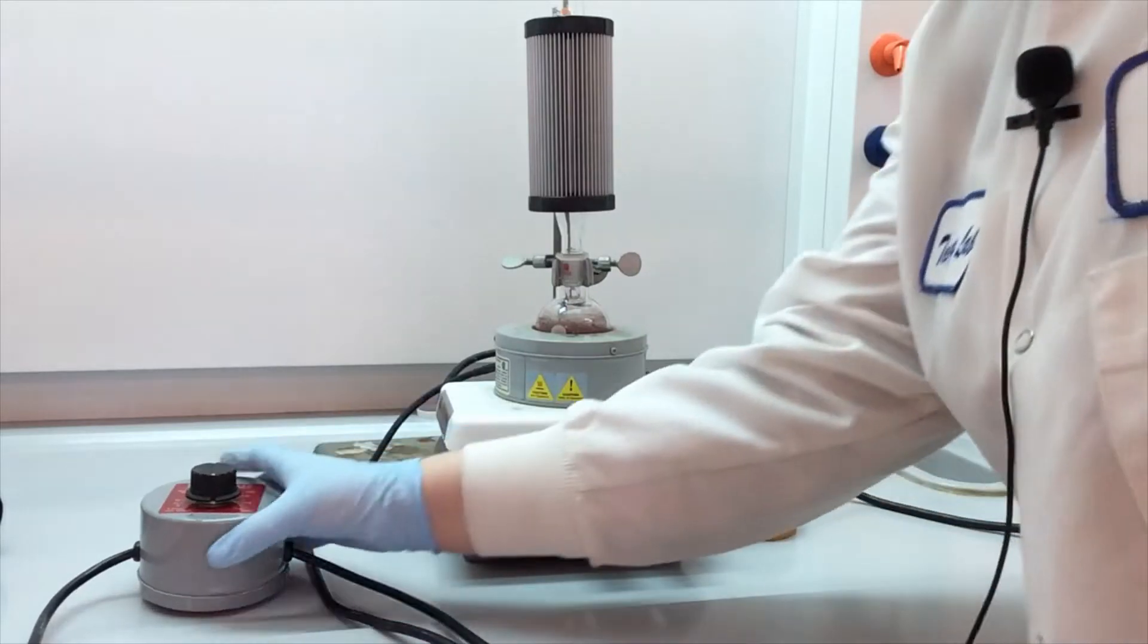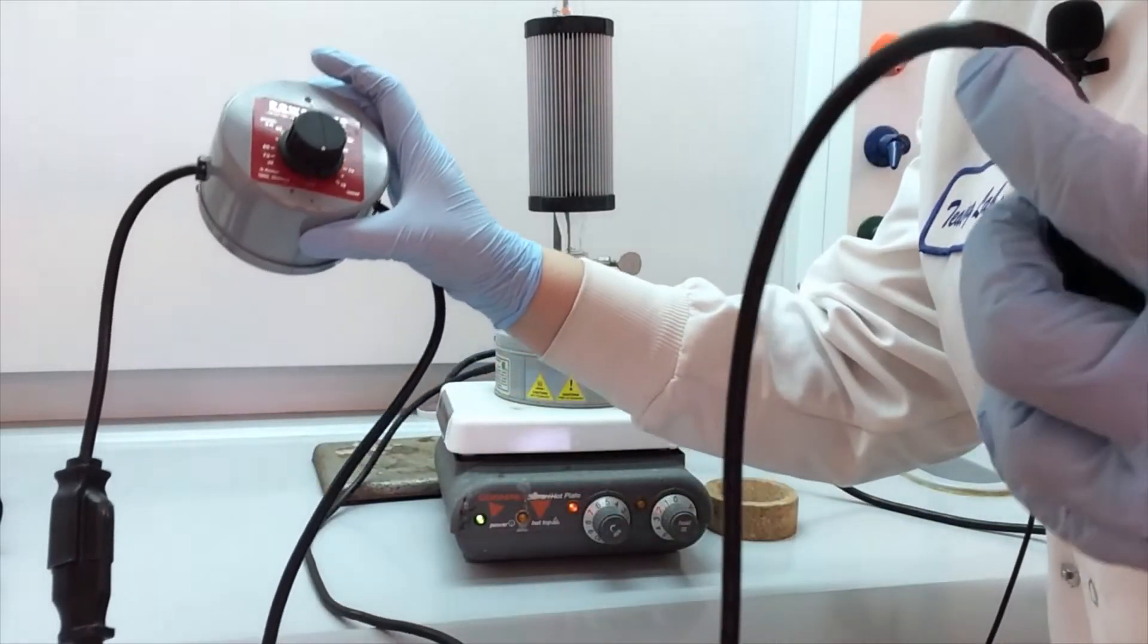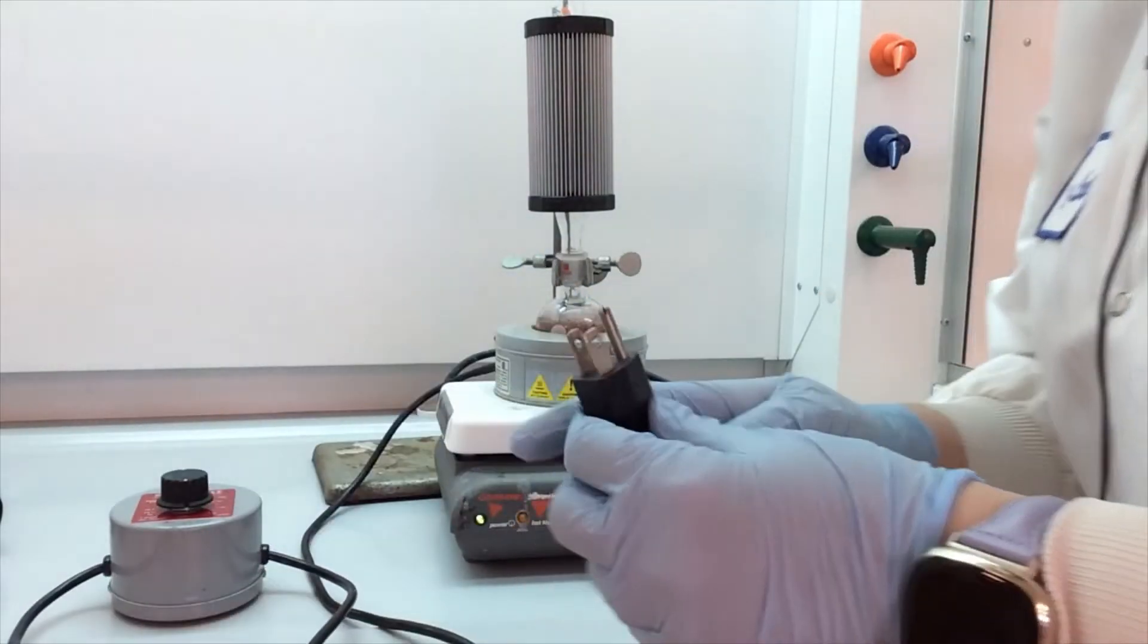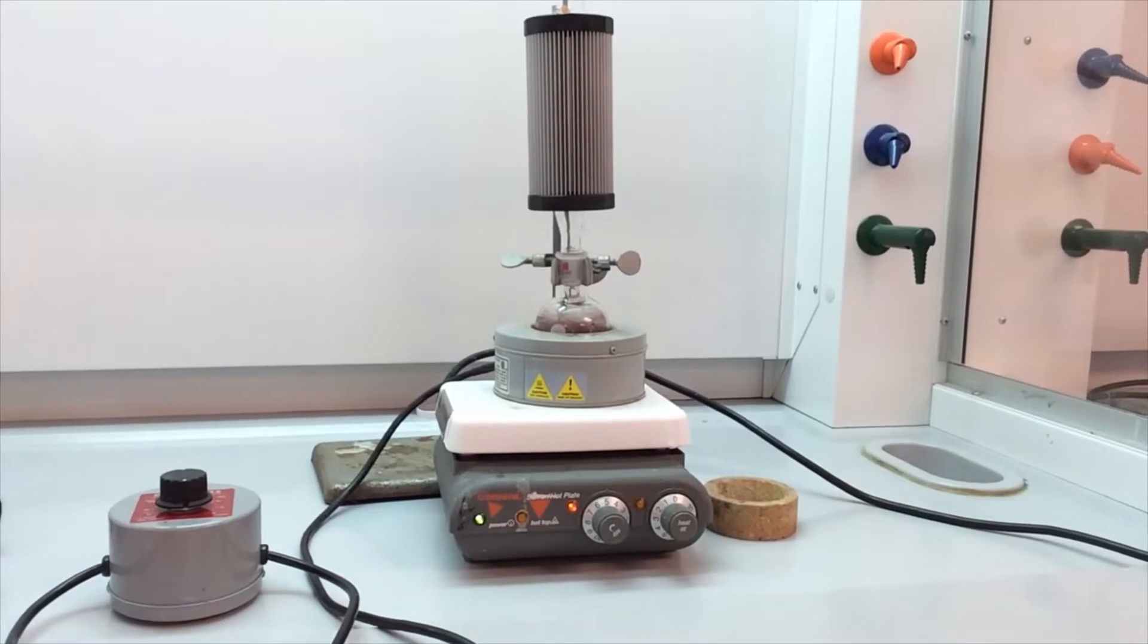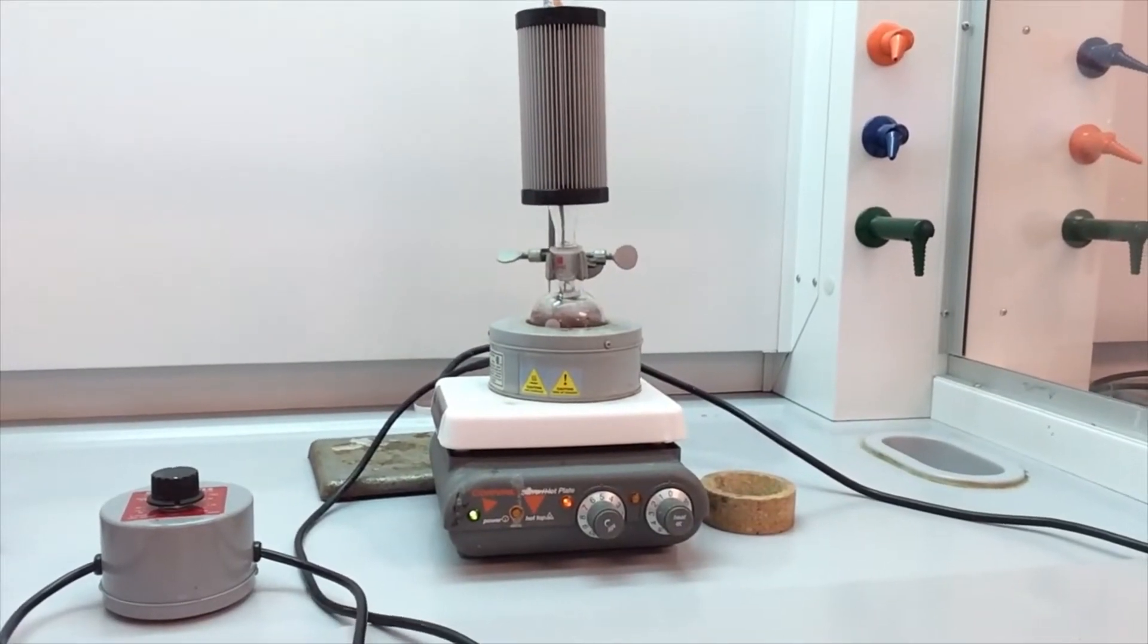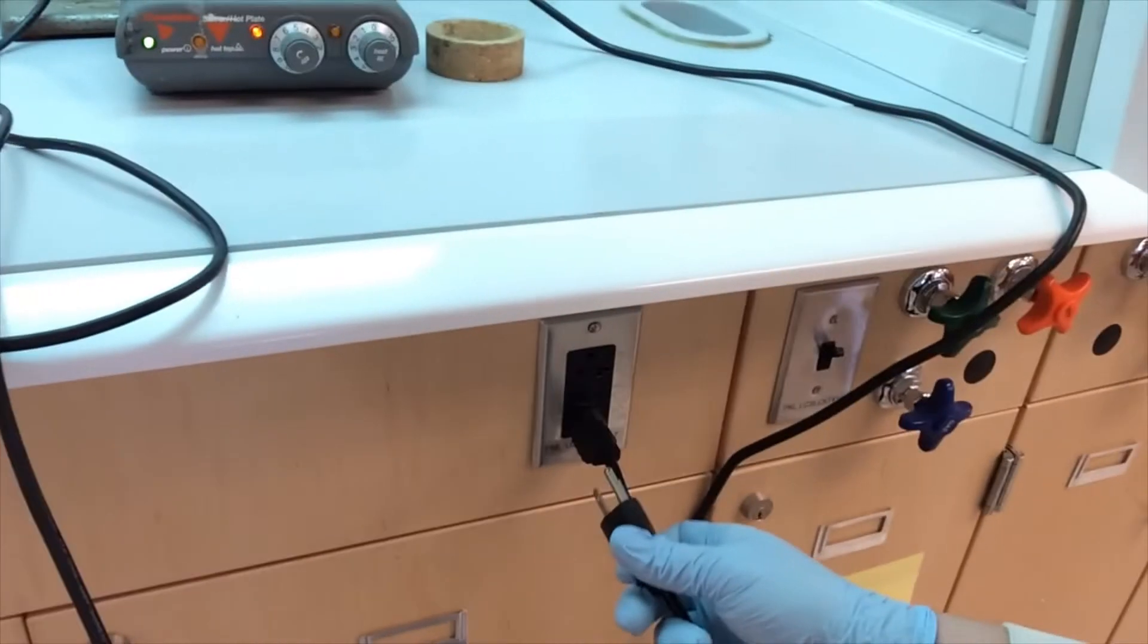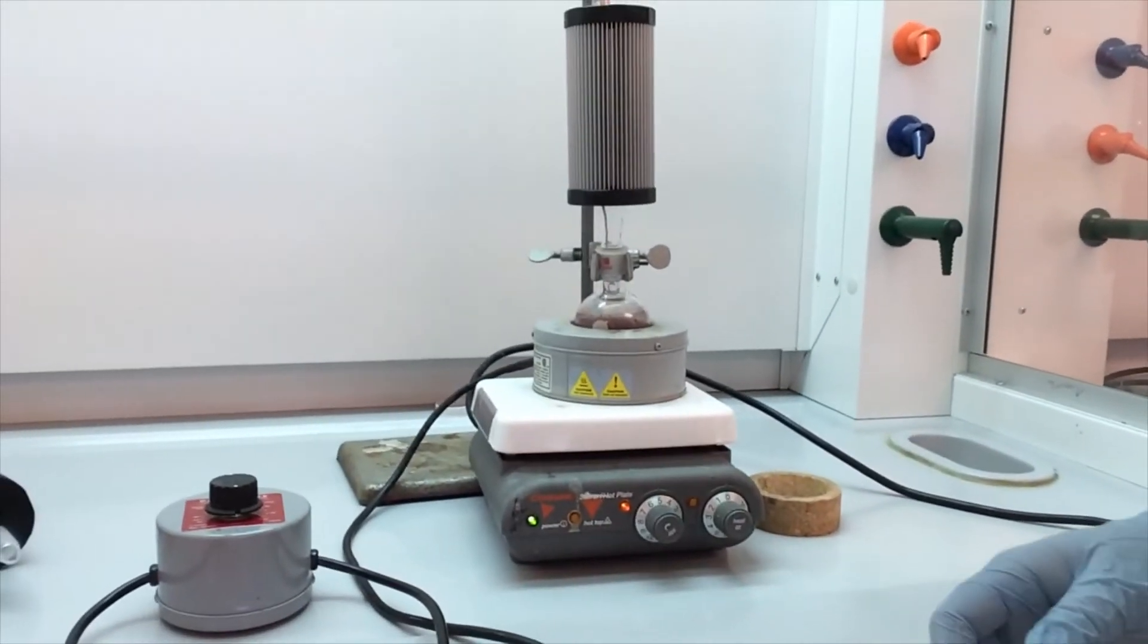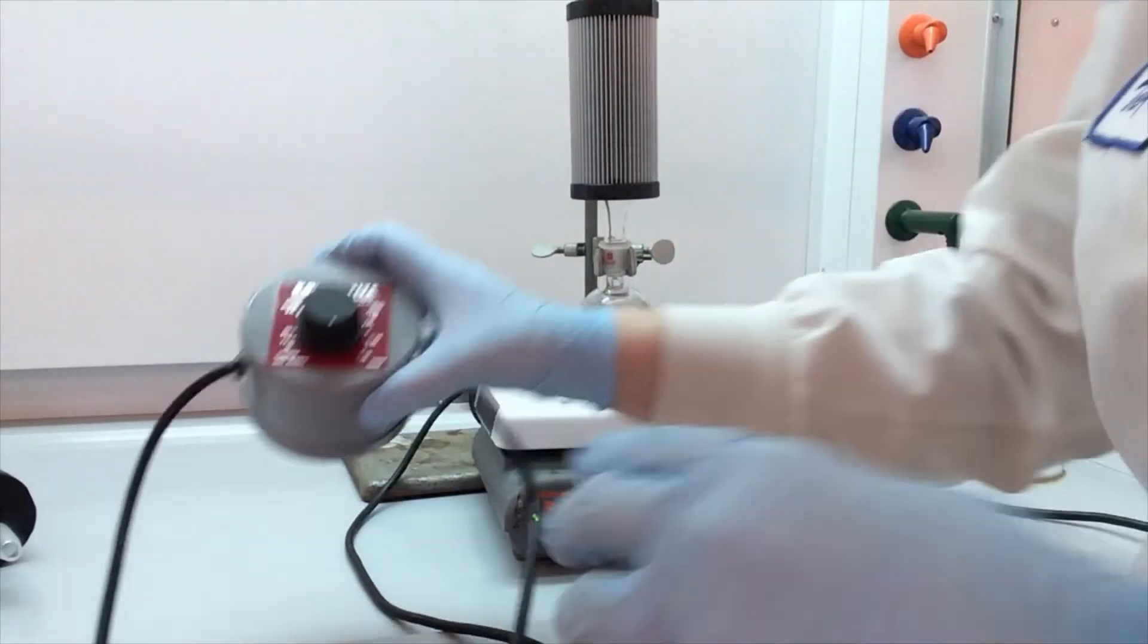And now we're ready to heat. So again, it's the controller that gets plugged into the outlet. There are outlets underneath your hood sash. Right here.